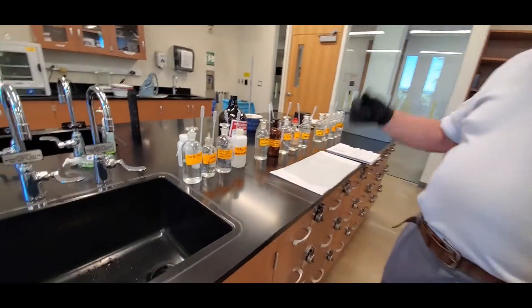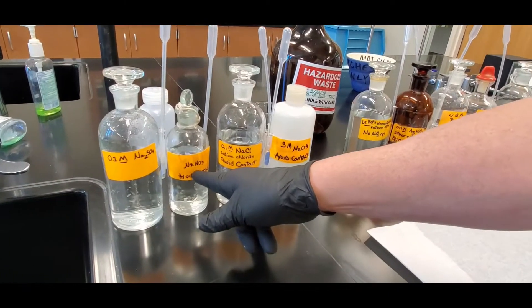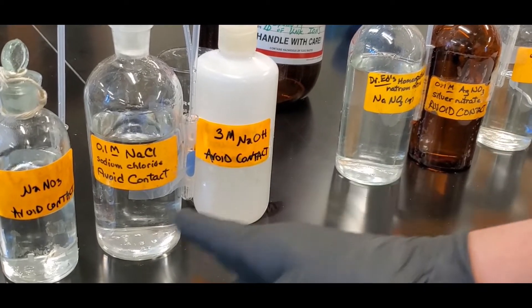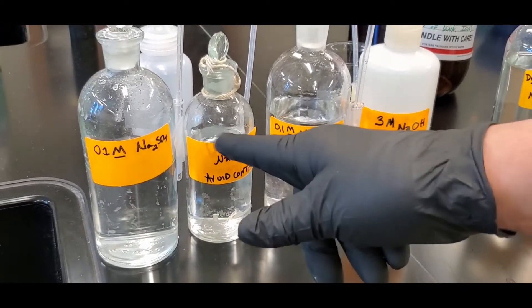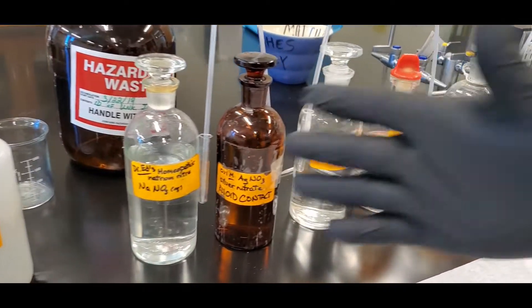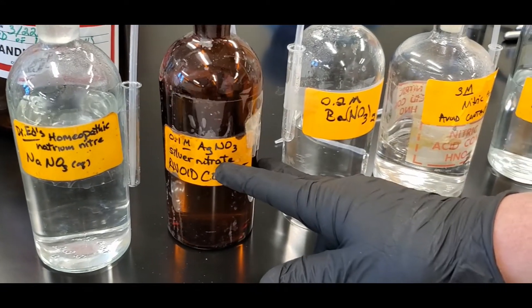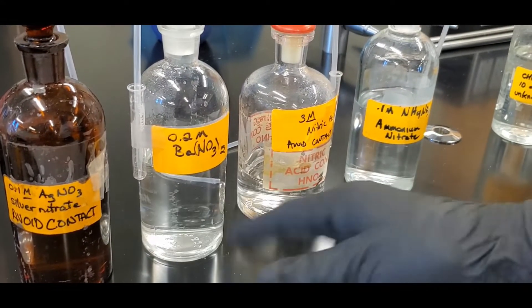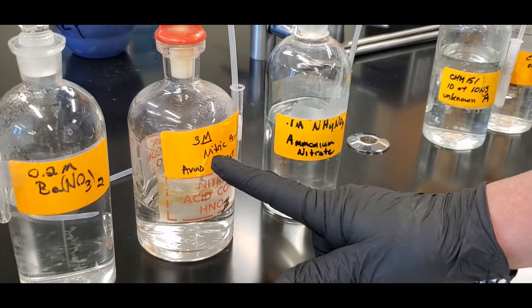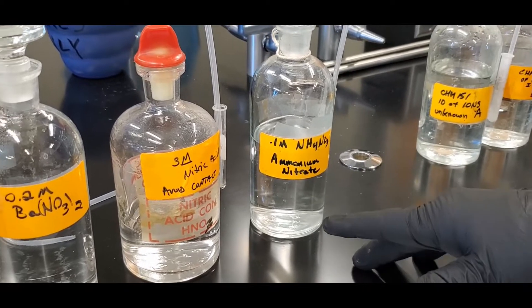We have four processing solutions: sodium sulfate, sodium nitrate, sodium chloride, and sodium hydroxide. The sodium ion acts as a spectator ion — the anion is the active ingredient. For cation standards, we have sodium nitrate for sodium, silver nitrate for silver (Ag+), barium nitrate for barium (Ba2+), nitric acid for hydrogen (H+), and ammonium nitrate for NH4+.